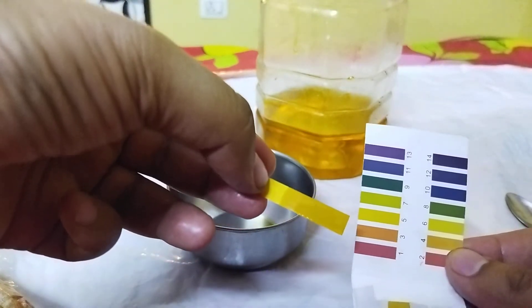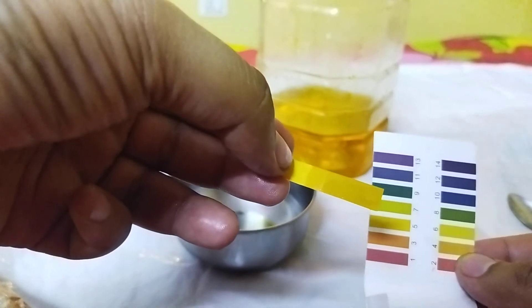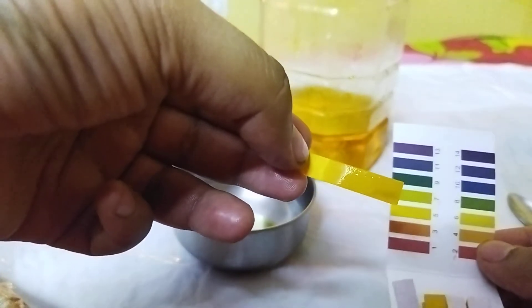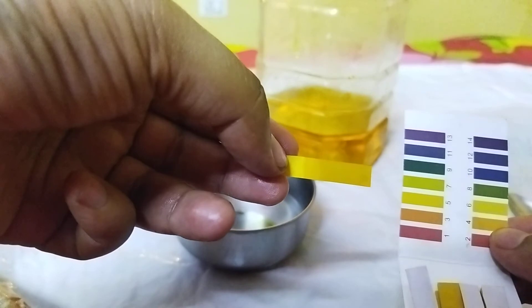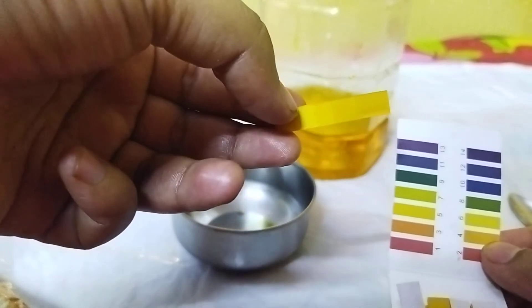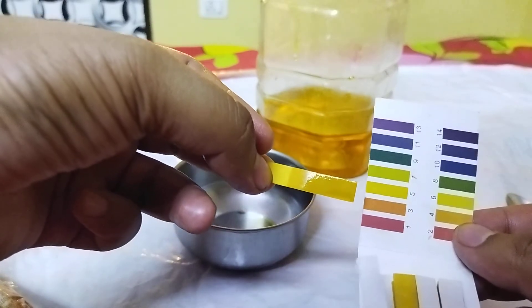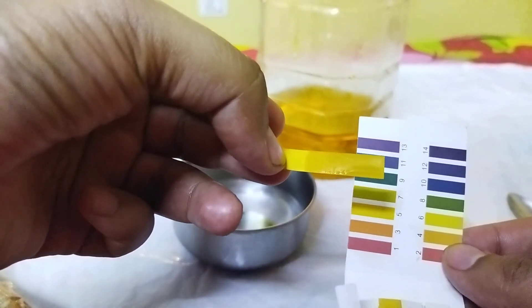We can also conclude that mustard oil, or sarso ka tel, is slightly acidic in nature. One more thing to notice is that the result may vary in your case depending on the brand you are using. In my case we are using local sarso ka tel — we bought it directly from the manufacturer. Results may vary, but it will possibly still be slightly acidic because the pH won't change much across brands.